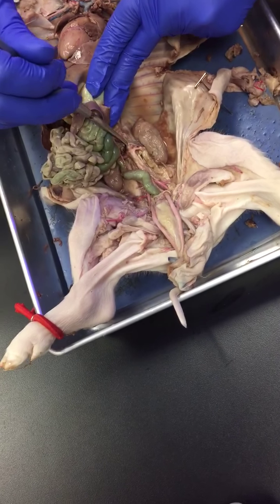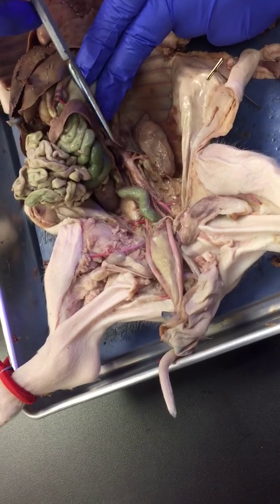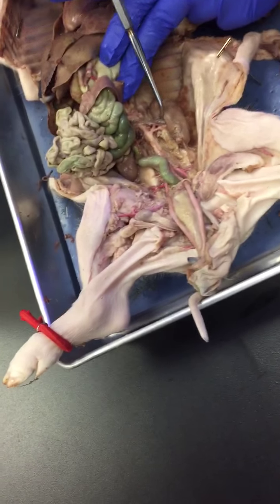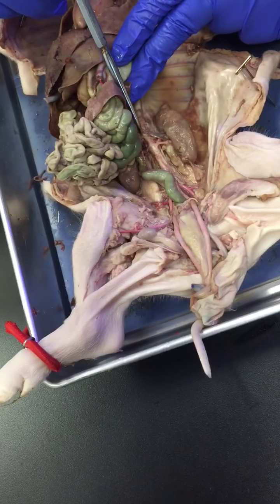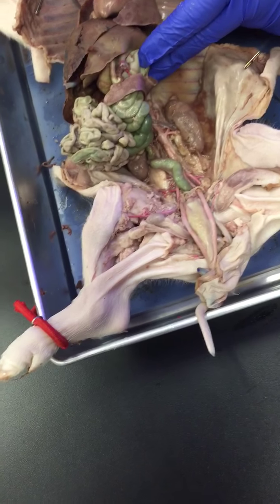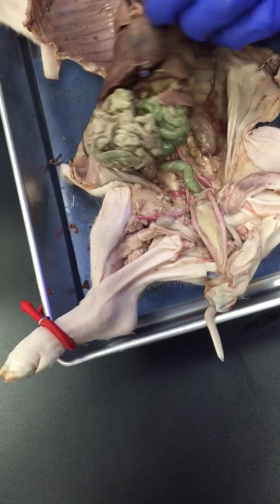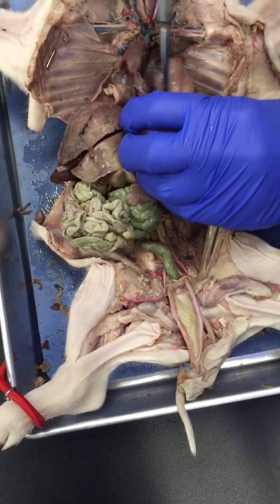Going further down, we see this. This is the renal artery. This is the renal vein. Okay? The ones that go to the kidney. So one is going and giving blood into the kidney. The other one is bringing back blood from the kidney. The renal vein is going to join the inferior vena cava. All right? So the inferior vena cava is this big blue tube right here.